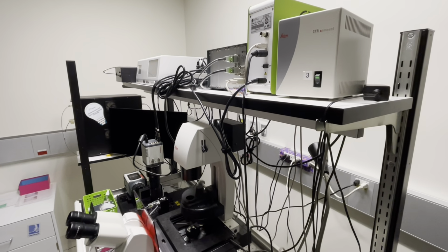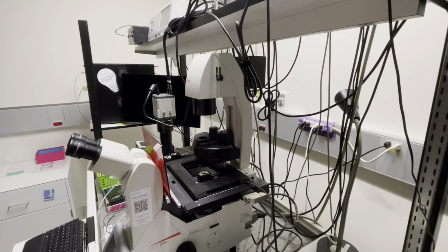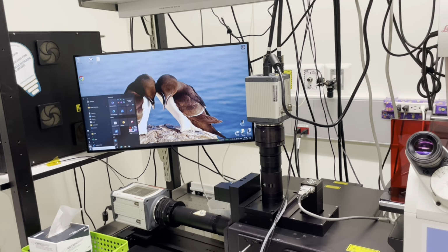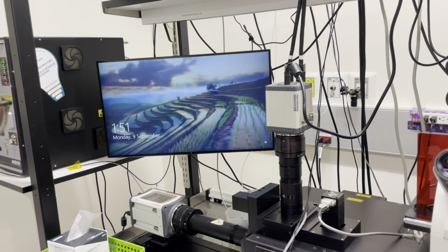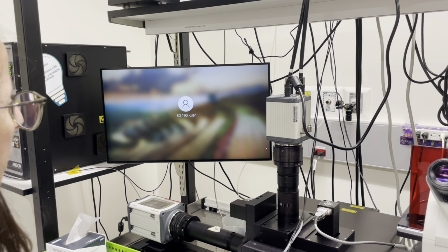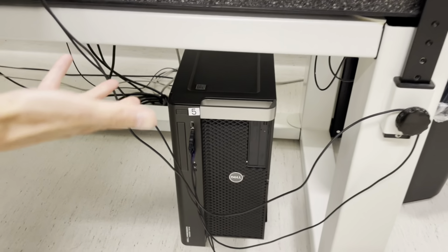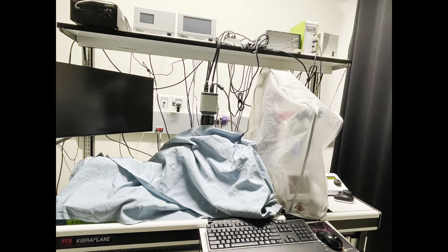Once your microscope is in a safe position to power off, then you can start the power off procedure. First, you'll want to shut down the software. For some software, you'll have to wait until the software fully powers off before turning off the hardware. Turn off, wait for the progress to proceed, then log out of Windows. Then you can shut down the PC and proceed to turn the hardware off in reverse order. 5, 4, 3, 2, and we skipped 1.